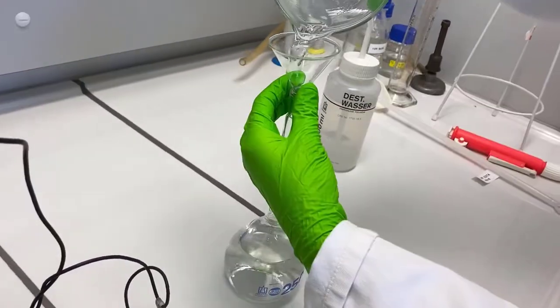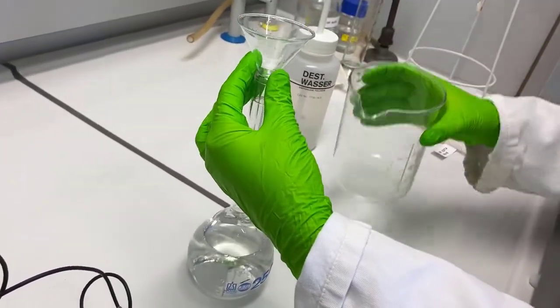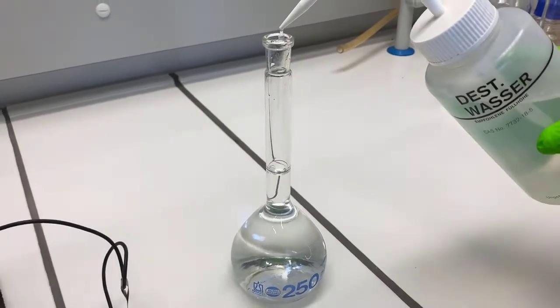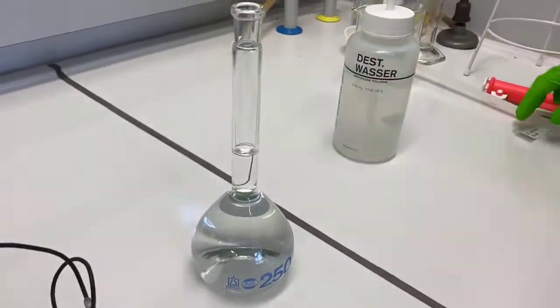Now as mentioned earlier, if you already have liquid EDTA in your lab, you can skip this step of dissolving EDTA powder and simply start from the next step.